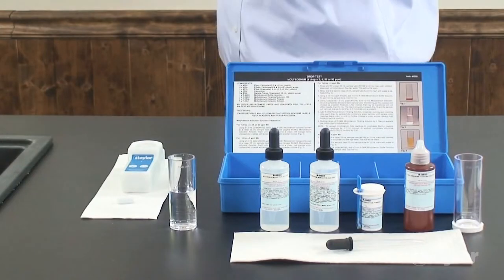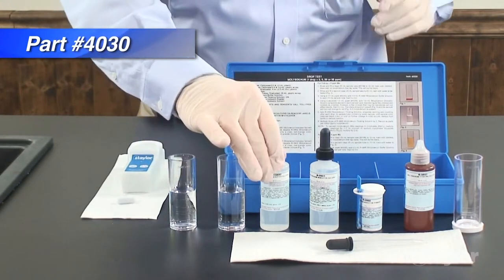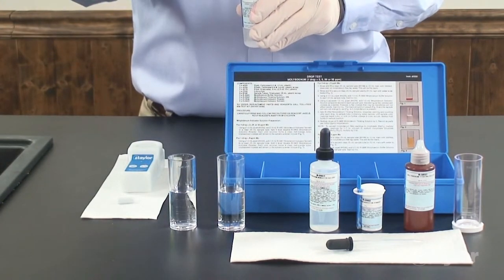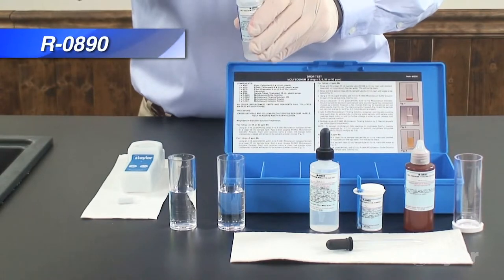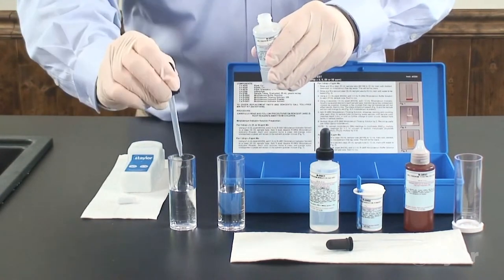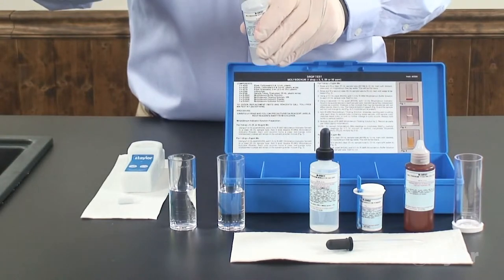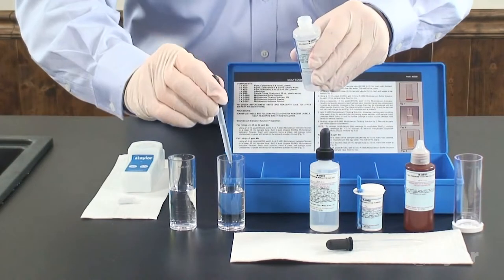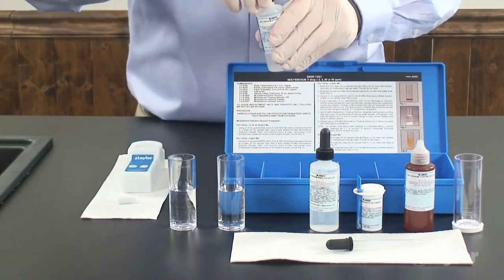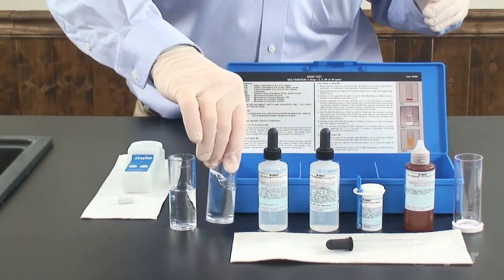Using a 1-milliliter pipette, add 1-milliliter of molybdenum buffer solution to each 25-milliliter sample tube. Swirl to mix.